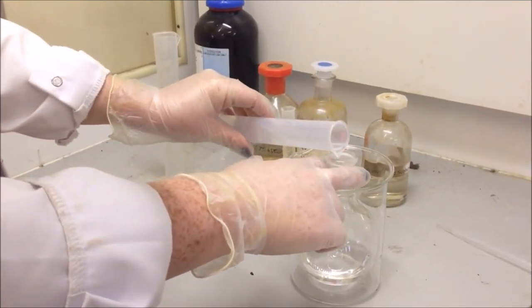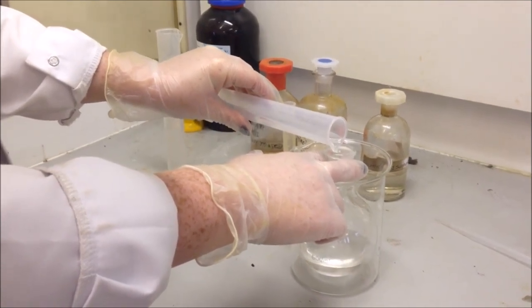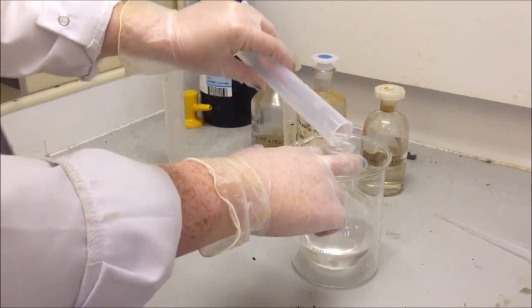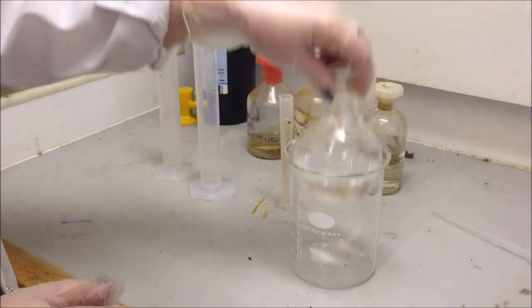This stuff is quite nasty and we are going to be using some quite nasty things, so I've been doing all of this in a fume hood. I'm going to give that a bit of a swirl to mix it up.